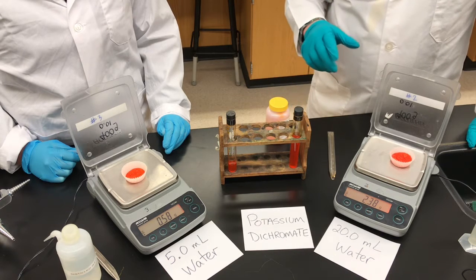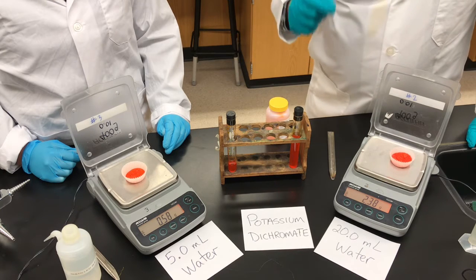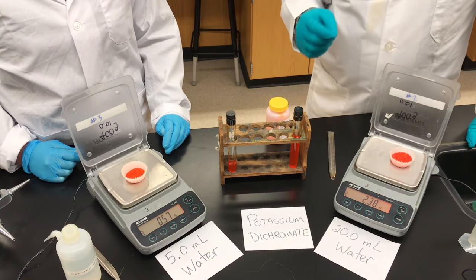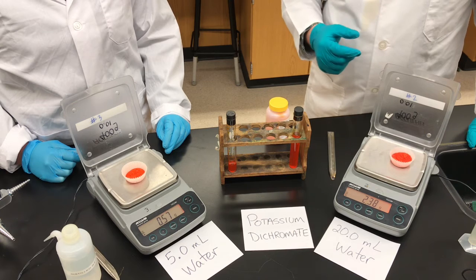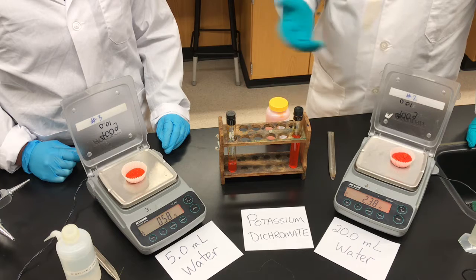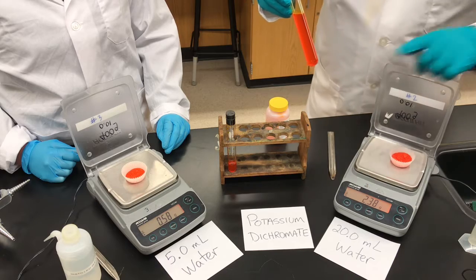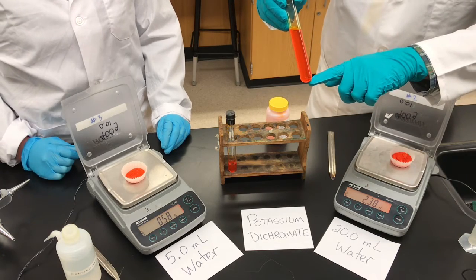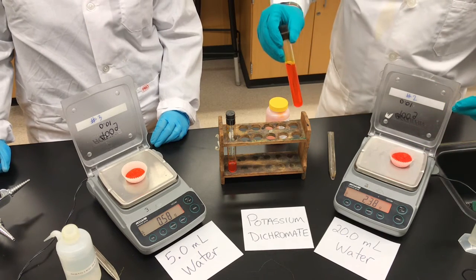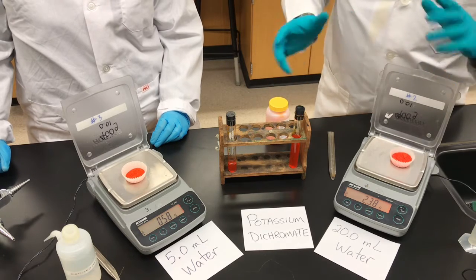One more piece of vocabulary: the concentration of a saturated solution is referred to as the solubility of that salt. So when you have the saturated solution's concentration, you know the solubility of the salt. This was not a very efficient way to find solubility — it took us several minutes of shaking, and in the end it's not that accurate because there's still undissolved salt, meaning the actual concentration of the solution is a little less than what you'll calculate. This is a tedious and not very accurate process for finding solubility.